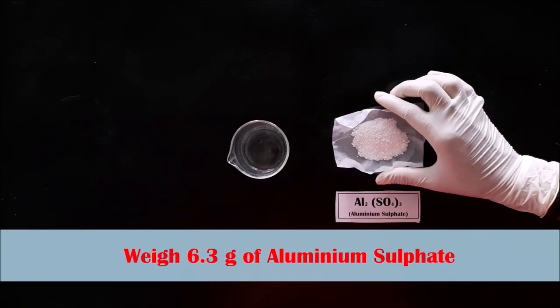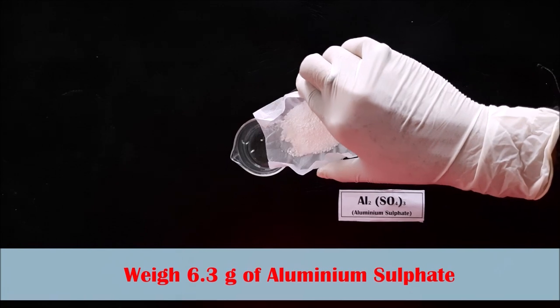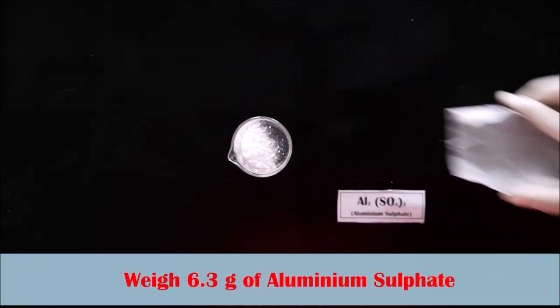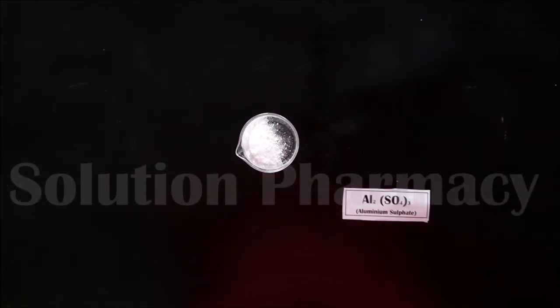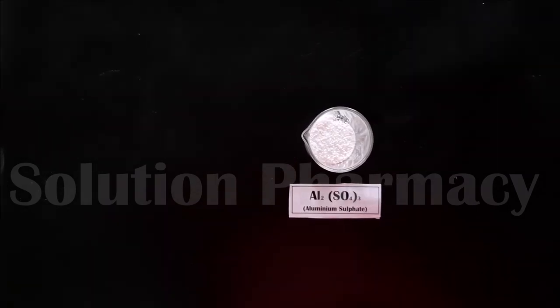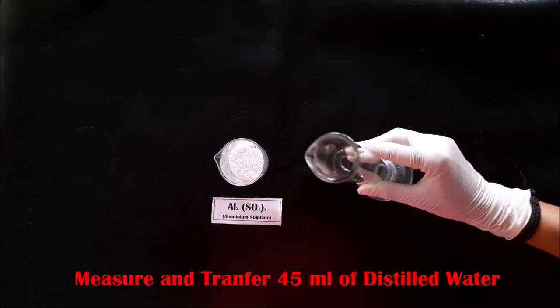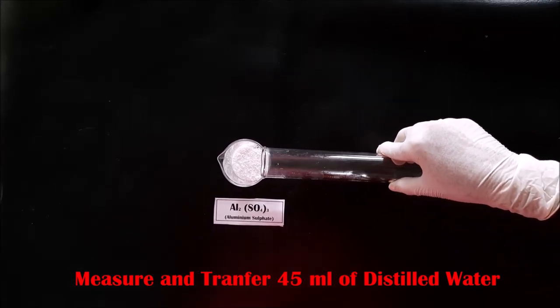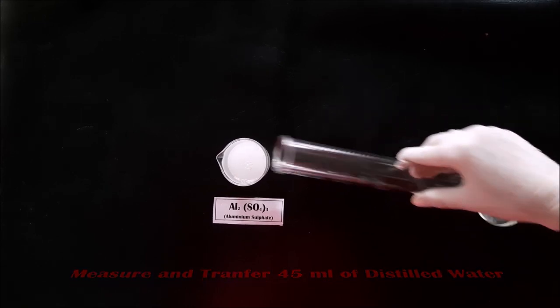Next, we prepare the solution of aluminum sulfate. We have taken 6.3 grams of aluminum sulfate and transferred it into a clean and dry beaker. Then measure and transfer 45 ml of distilled water into the beaker containing the aluminum sulfate.